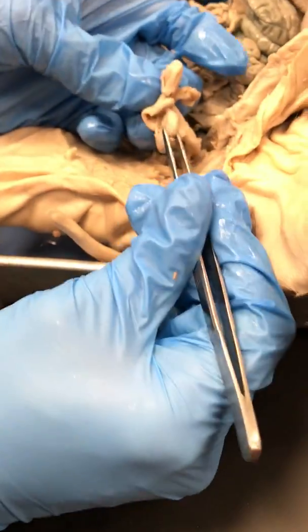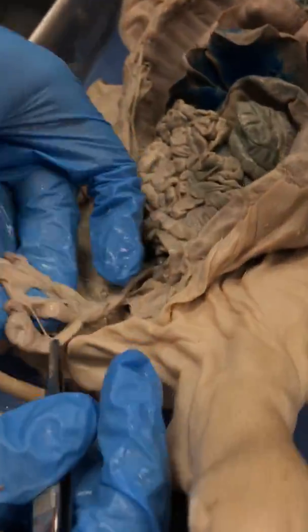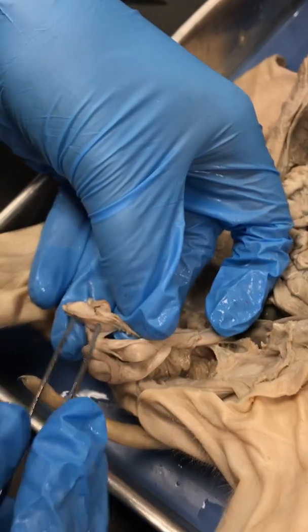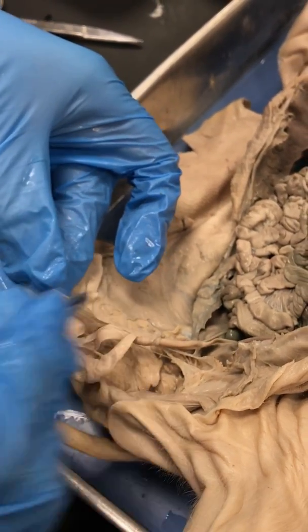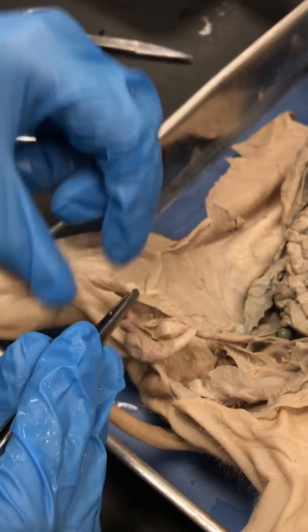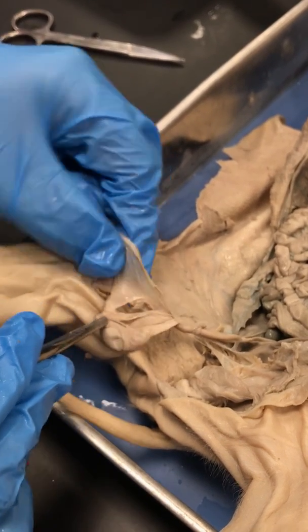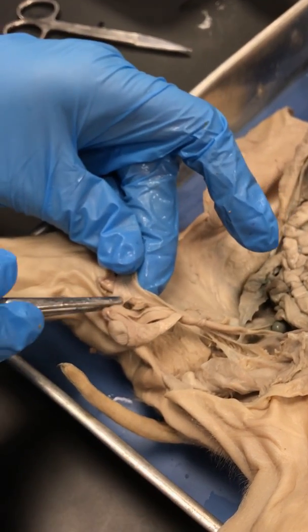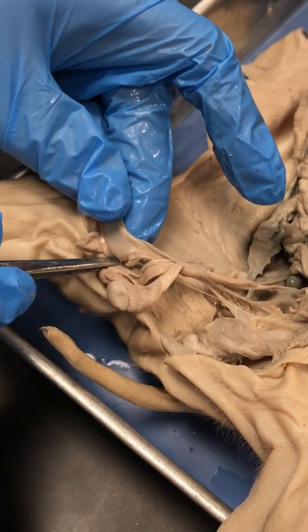When we extracted one of the testicles and completely dissected it, you can see you've got several different structures. You have this really nice thin membrane that encased all the structures of the testicle and all the supporting organs, and that was called the vaginal tunic. The vaginal tunic was attached to its interior structures by this thin membrane called the gubernaculum.